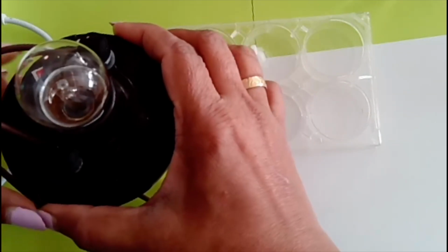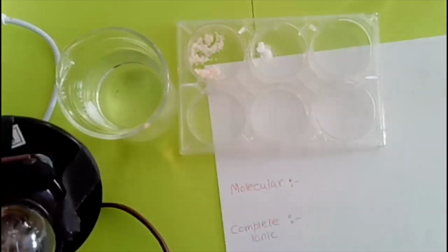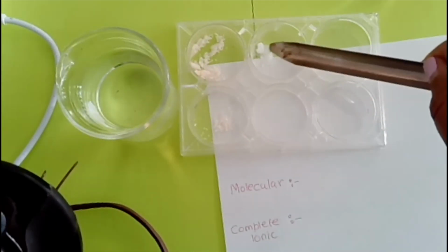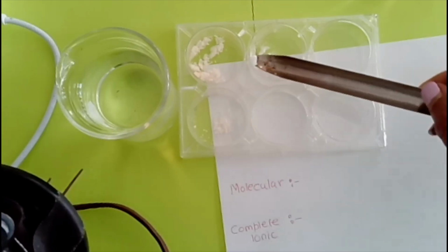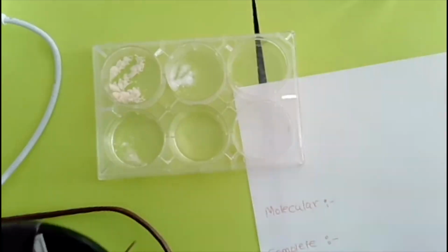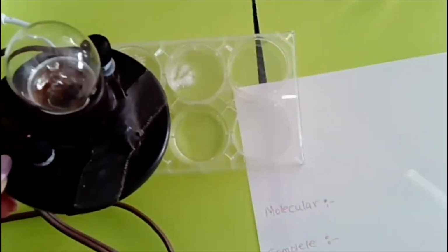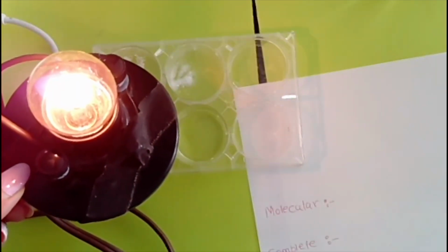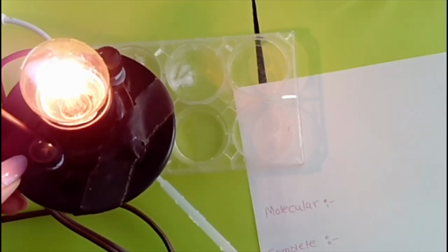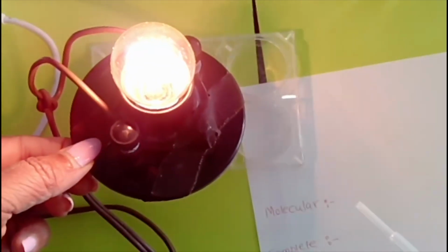And now, if I take a little bit of this solid and I put this here, and I put a little bit of this solid and I put it over here, and I'm going to add some water. Now if I added some water here, should it light up now? Yes, that same water that was not lighting up, because now what did the water do? It pulled those ions and it is able to light up. Same thing will happen over here. You are able to light that up.